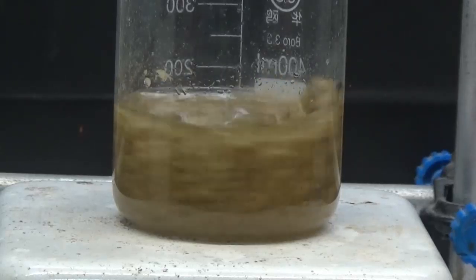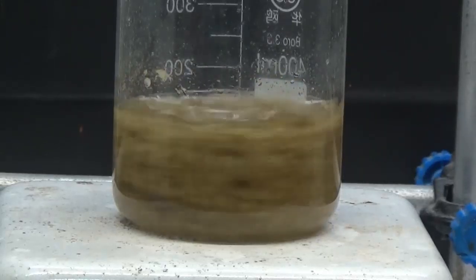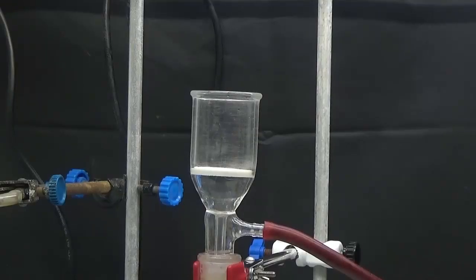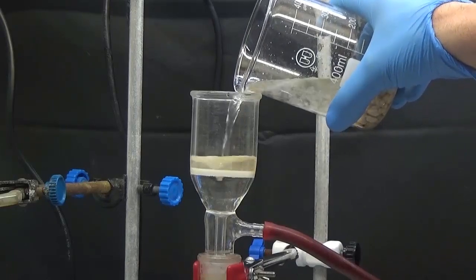Let it stir for three to four hours. Collect the solid by suction in a funnel with a vacuum connection.